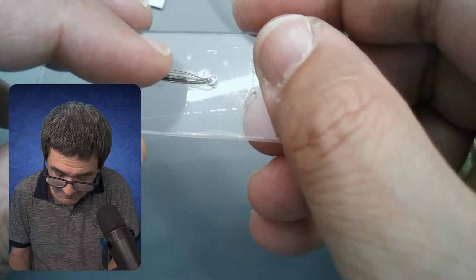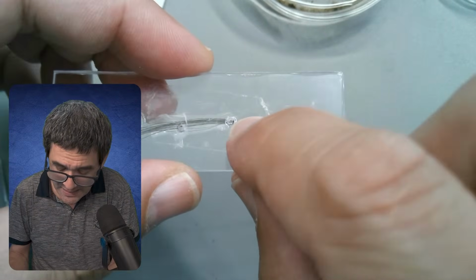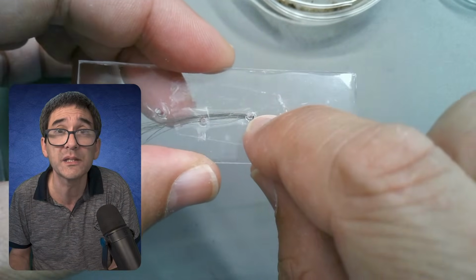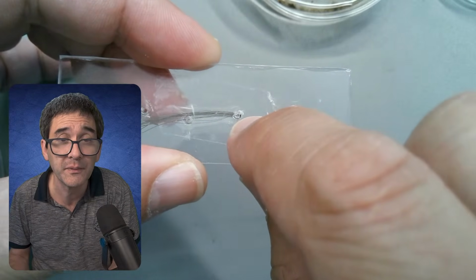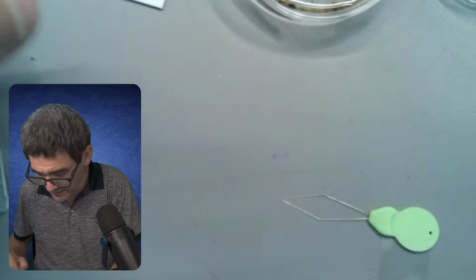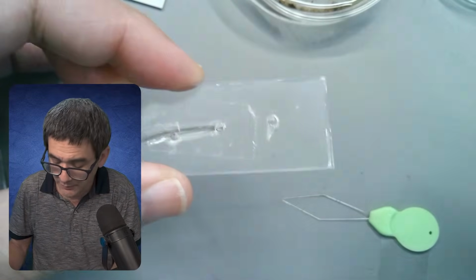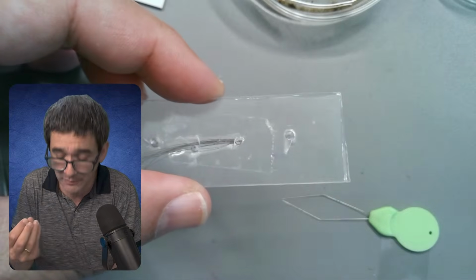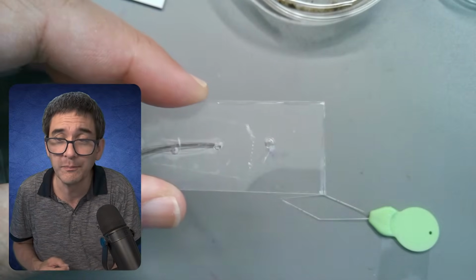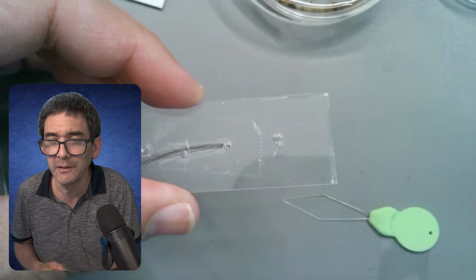I fixed the hair with tape on one side, and the hair was standing out on the other side, and I added some nail polish here to glue it in place. And then I used a sharp razor blade to cut it off. The idea is I wanted to look at the hair perpendicularly, right? It didn't work.